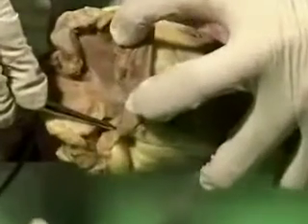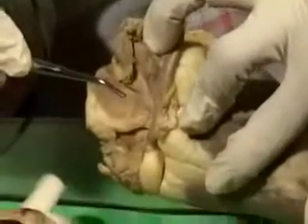Then we have the atrioventricular opening or the tricuspid opening, and there, if you can see in there, that's the right atrioventricular opening. And the opening of the coronary sinus is up here. If you look here, I'm going to put my little probe in there. That's the opening of the coronary sinus. You don't see openings of the venae cordis minimi because they're really small. In fact, you can see one over here, very, very small. So that's the right atrium.